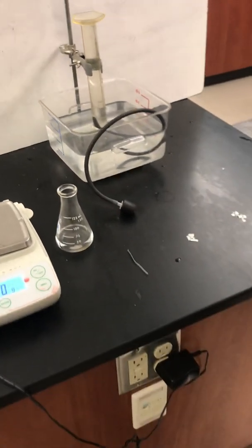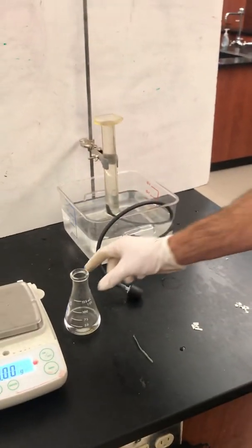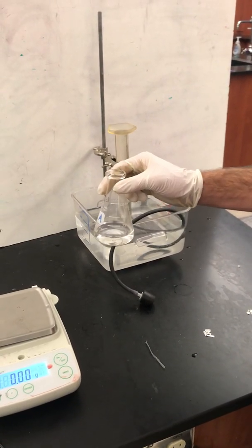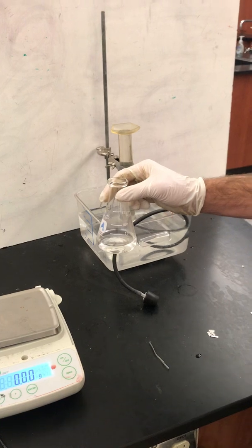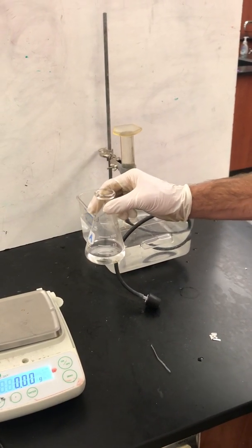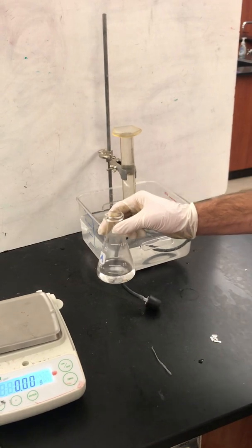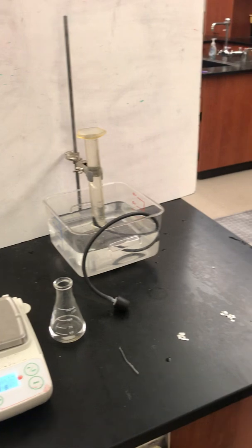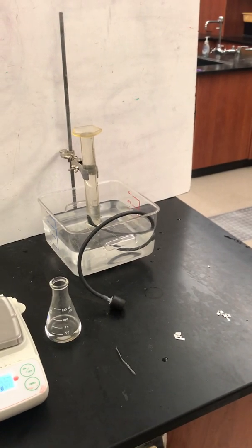A third option is you could manipulate the temperature of the hydrochloric acid. You could use a hot plate to do that and heat it up to 3 different temperatures, or one could be room temperature. And if you were to do that, then you'd keep the concentration of hydrochloric acid the same and the mass and surface area of magnesium the same as well, those being controlled variables.